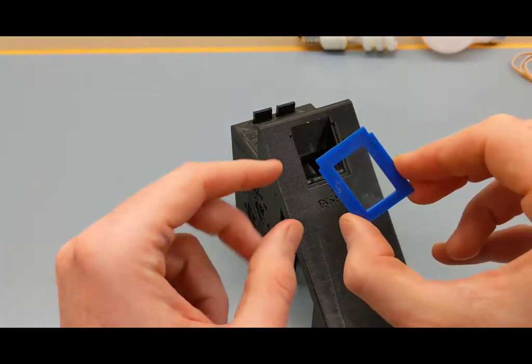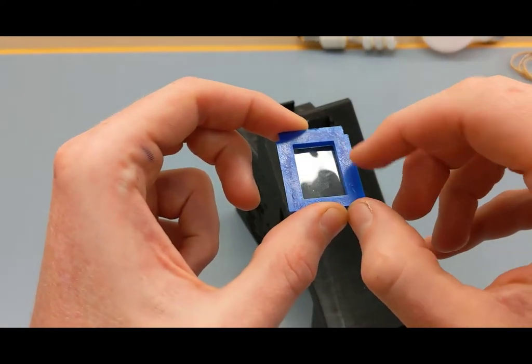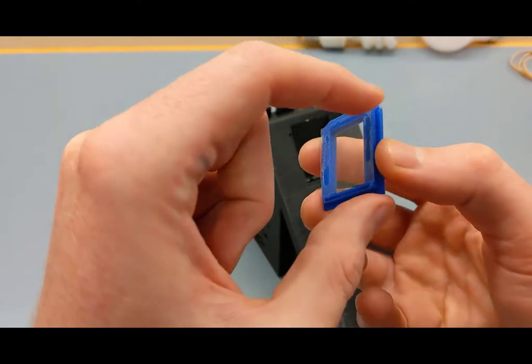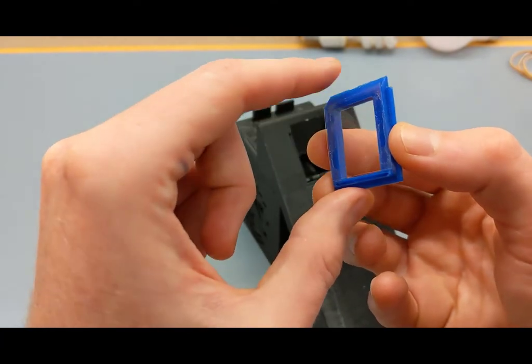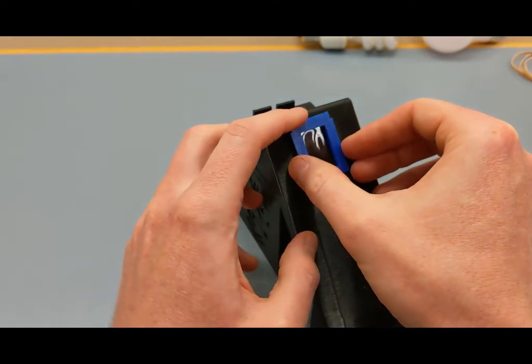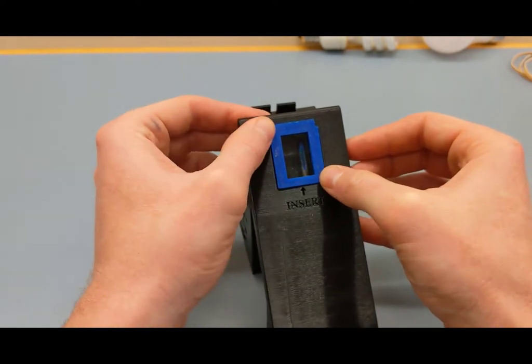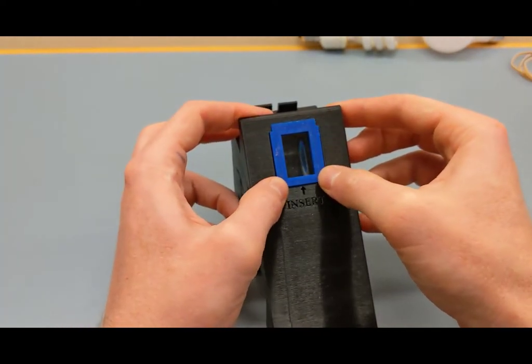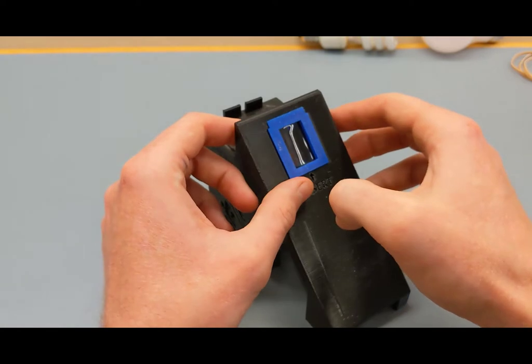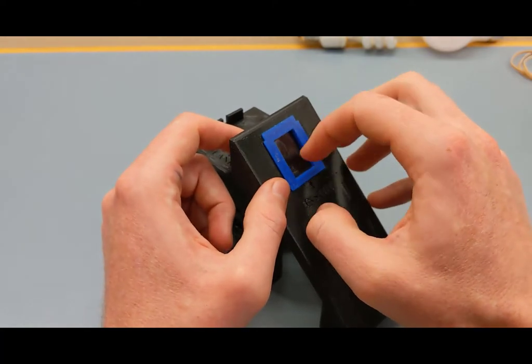You can see there are a couple of notches in the top left and right of the insert, and a really flat side. The flat side faces out towards you; the non-flat side with the glued diffraction grating faces in towards the mirror. Line it up and carefully push it in. The degree of tightness will vary by kit — some are loose and some are tighter depending on print scale.